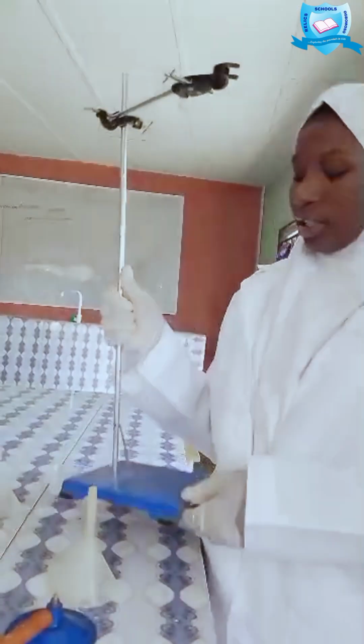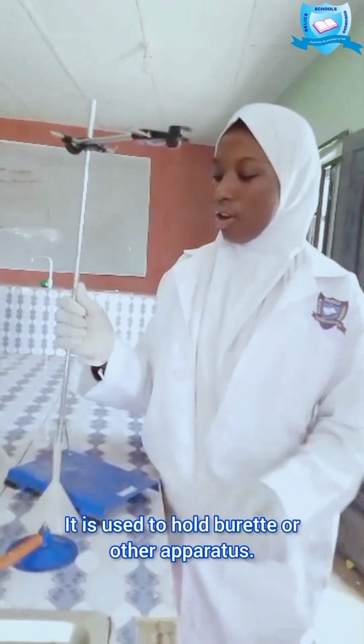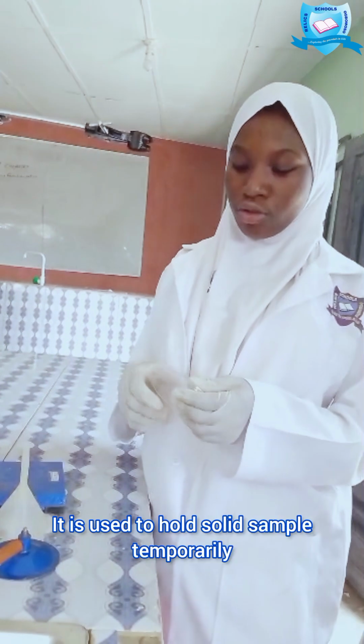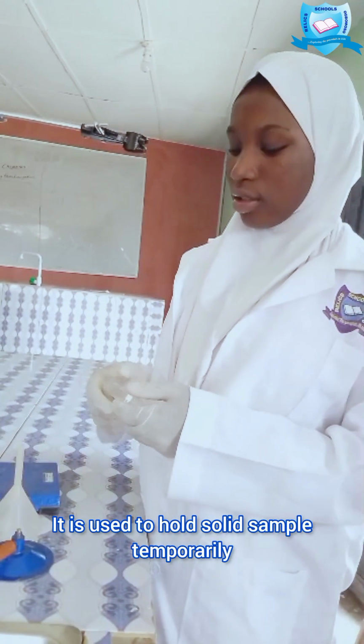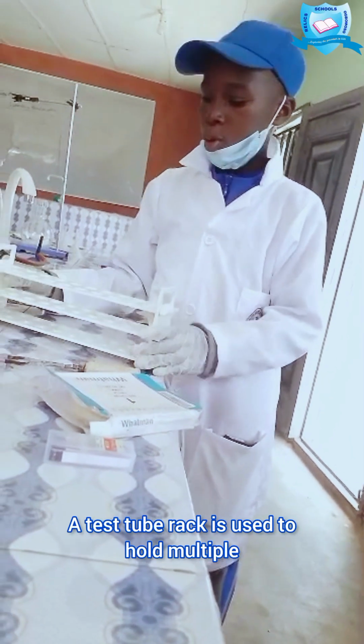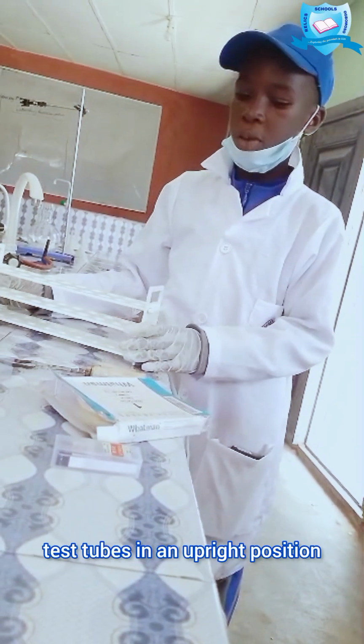These are retort stands. They are used to hold burettes or other apparatus. These are petri dishes. They are used to hold solid samples temporarily. A test tube rack is used to hold multiple test tubes in an upright position.